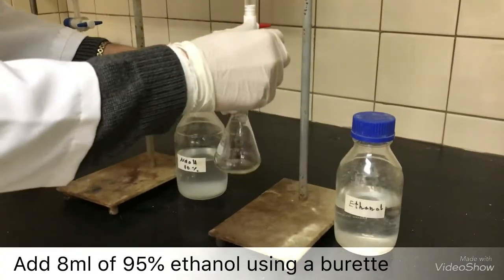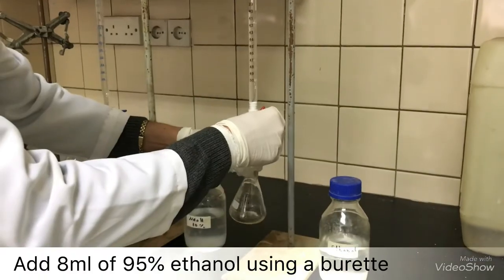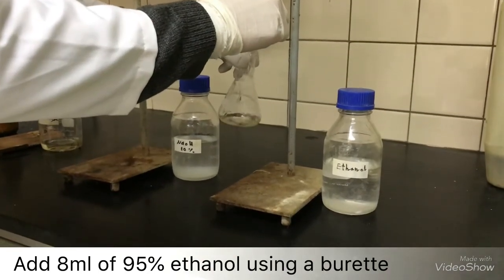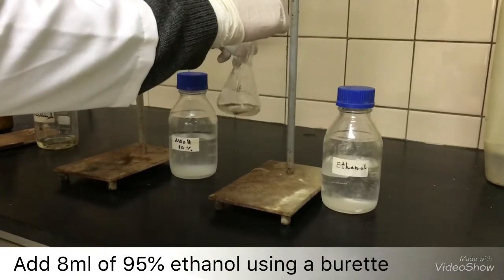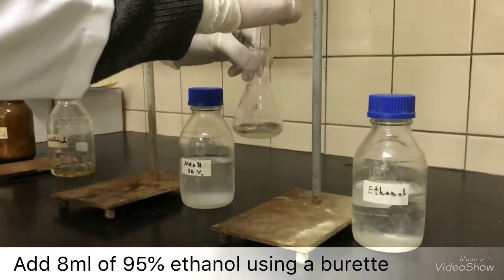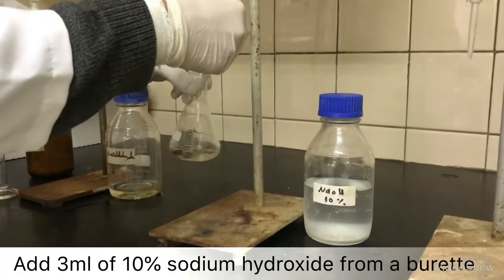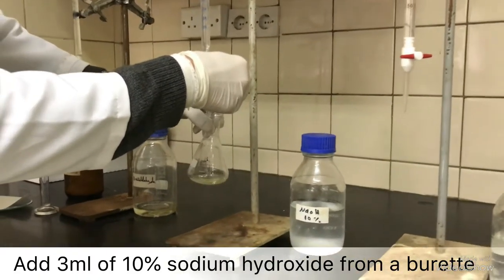Now, start adding 8 ml of ethanol, 95%, from a burette filled with ethanol. Now, add 3 ml of 10% sodium hydroxide, also from a burette.